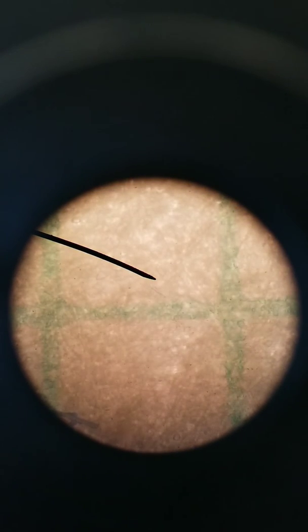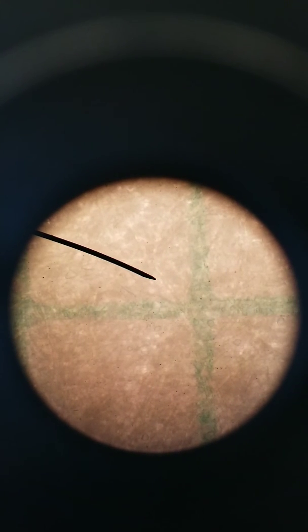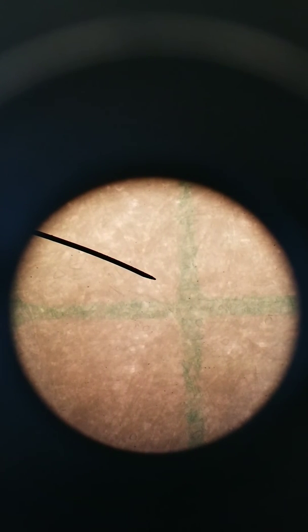If we switch to the 10x objective, the low power, that's a total of 100x. At a total magnification of 100x, again, the camera zooms it in a little bit more than it should be. We're fitting across 2 squares in this field of view. Because we have a field of view of 2 squares, that means it's 2 millimeters, in other words, 2,000 micrometers. At a total magnification of 100x, we have a field of view diameter of 2,000 micrometers.